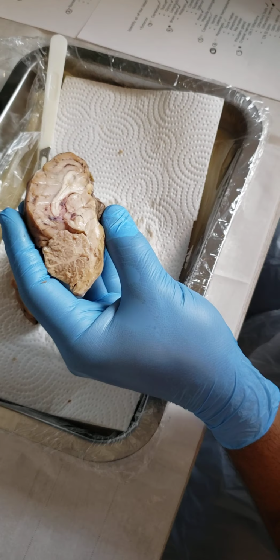Next, the trigeminal and the trochlear. The trigeminal nerve is in the rear. Let's see if it's a little easier to tell on this one. I believe this is the trigeminal nerve back here in the rear.